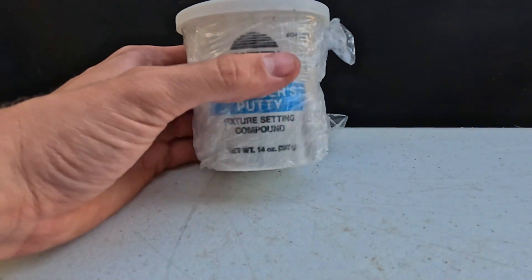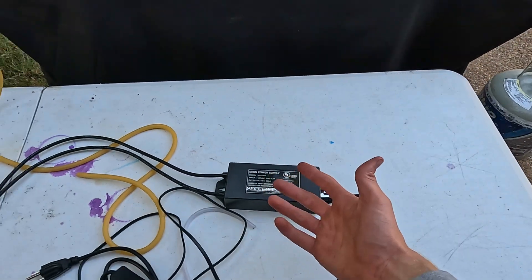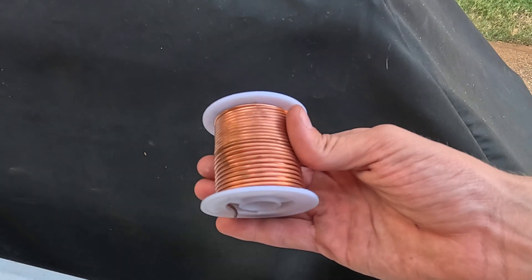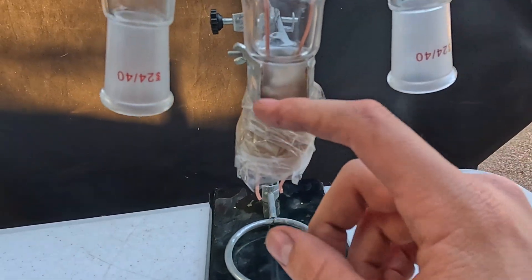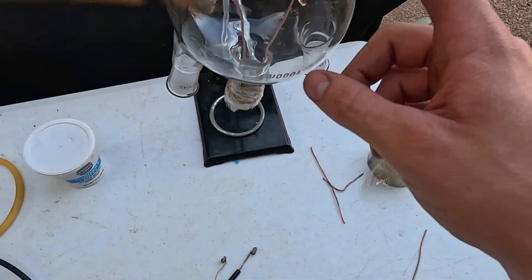We need to work on something that will seal the air, and my initial instinct is to use plumber's putty because it withstands high temperatures. It's important we use something like plumber's putty because if I tried hot glue, it would just re-melt — this thing produces a whole lot of heat. To make working with these copper wires easier, I went ahead and stabbed some holes in a milk jug so the copper wires wouldn't touch. For this experiment I'm using 12-gauge wire. We have it sealed with the putty and taped so it doesn't fall down, and I've also lengthened the wires so it can arc.